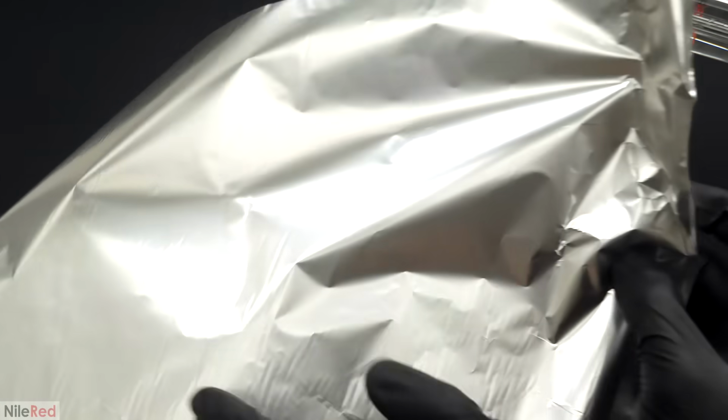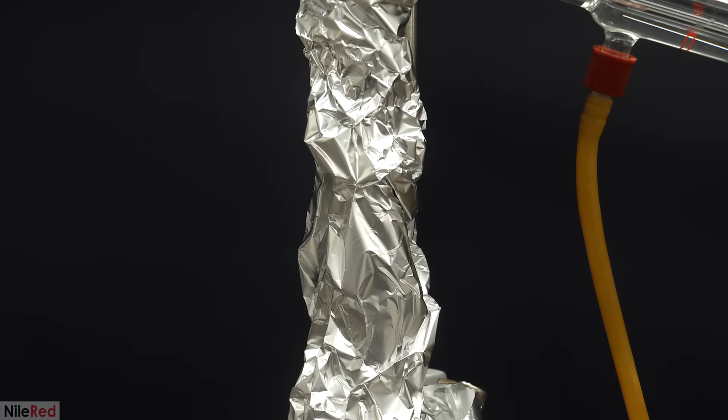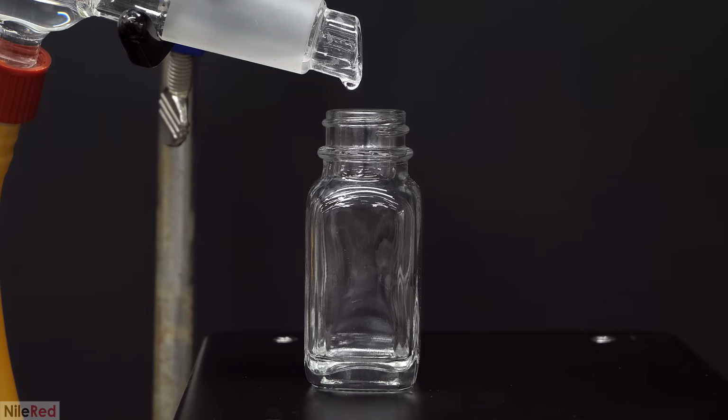One major difference between this distillation and the last one was that there was way less water, so I could actually pay attention to the temperature. The first drop showed up at around 70 C, and then it slowly rose to 79 C, where it remained constant. This initial amount was called the foreshot, and it contained almost entirely low boiling point side products. In this section, if it were present, most of the methanol would come over, but I don't think that there was any here.